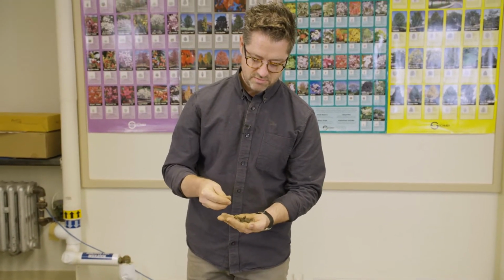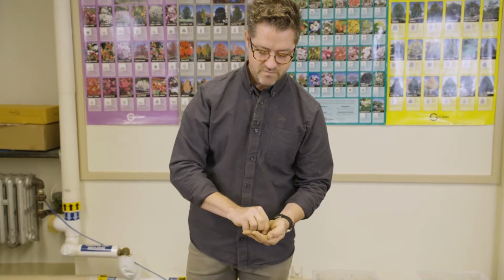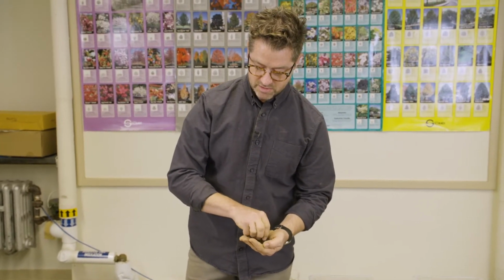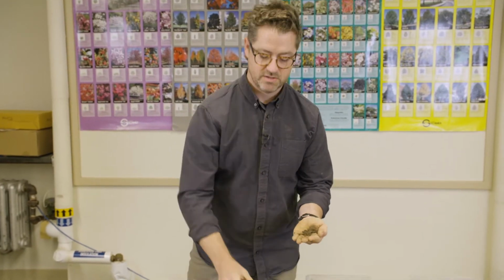about a teaspoon or two here. And I'm going to wet it in the palm of my hand.